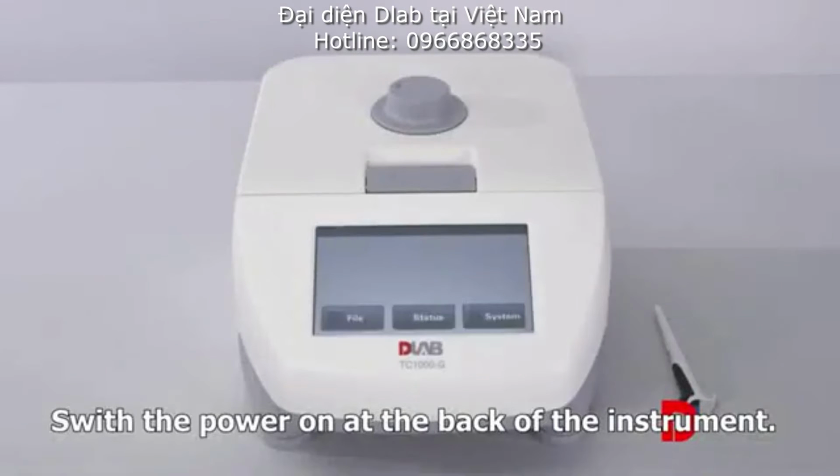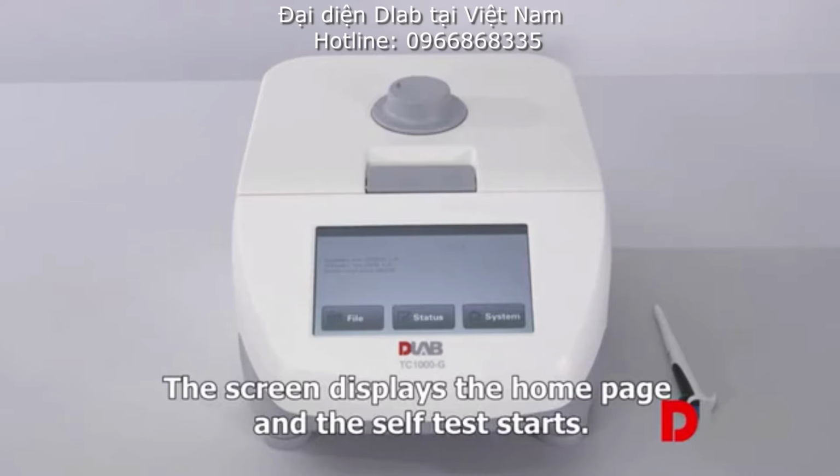Switch the power on at the back of the instrument. The screen displays the home page and the self-test starts.